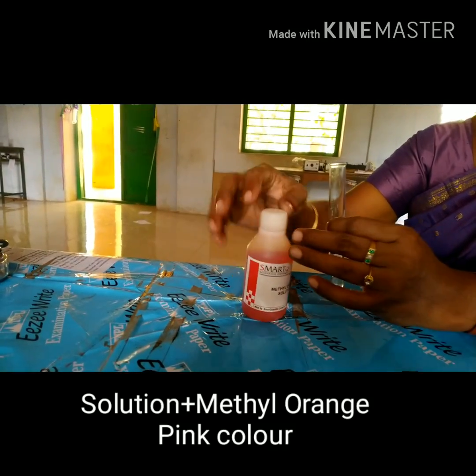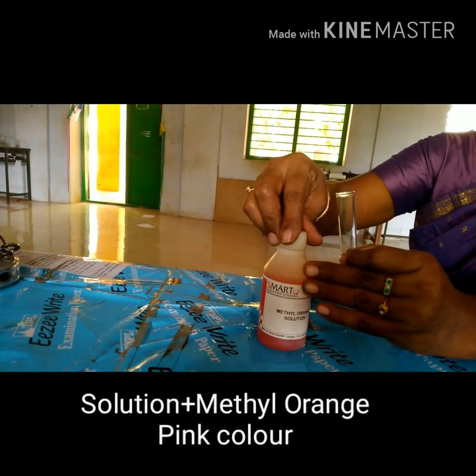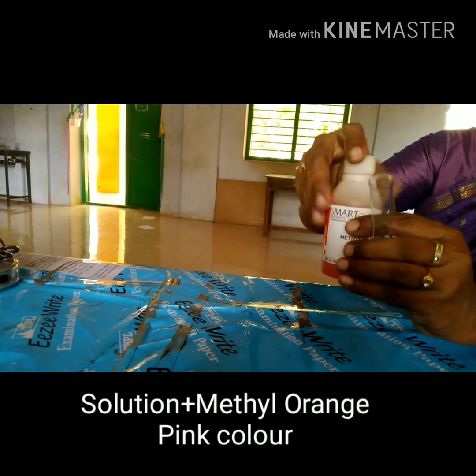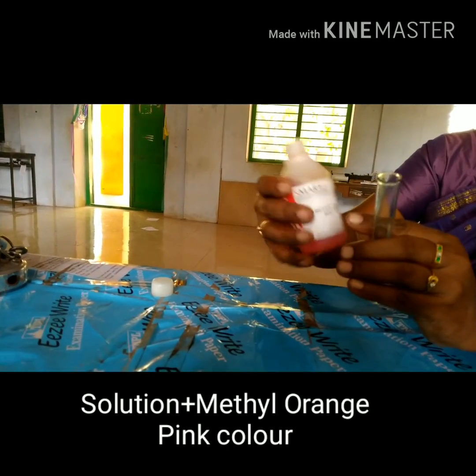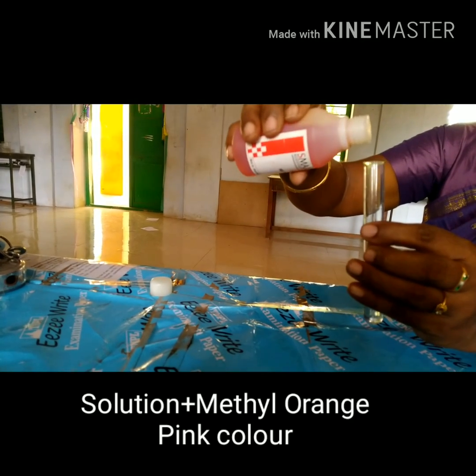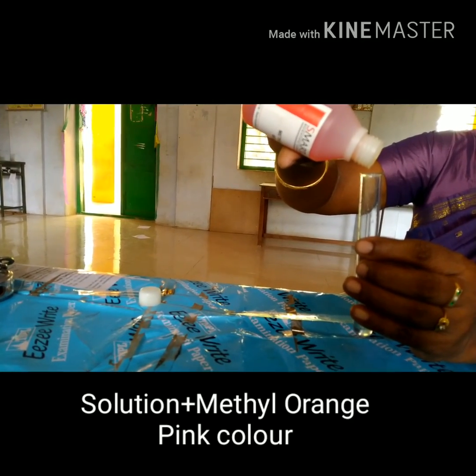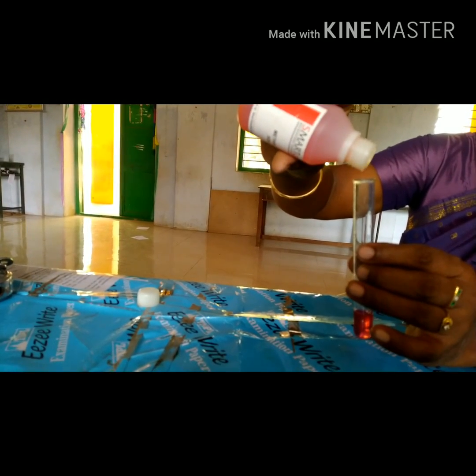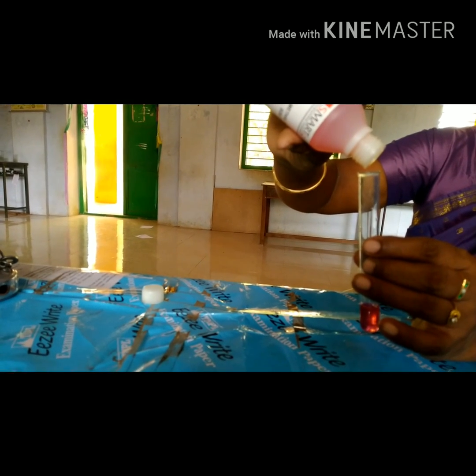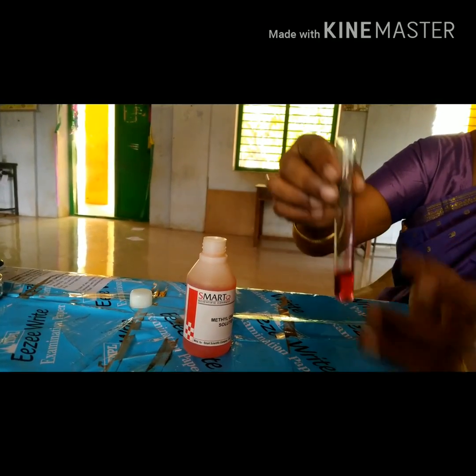Now you take 5 ml of the given solution and add few drops of methyl orange. Note the differences — the solution turns into pink color. So now let us come to the conclusion that the given solution is acid, as the solution turns into pink color.